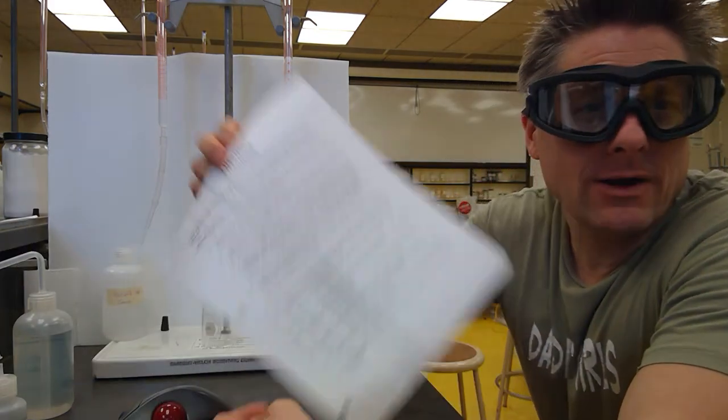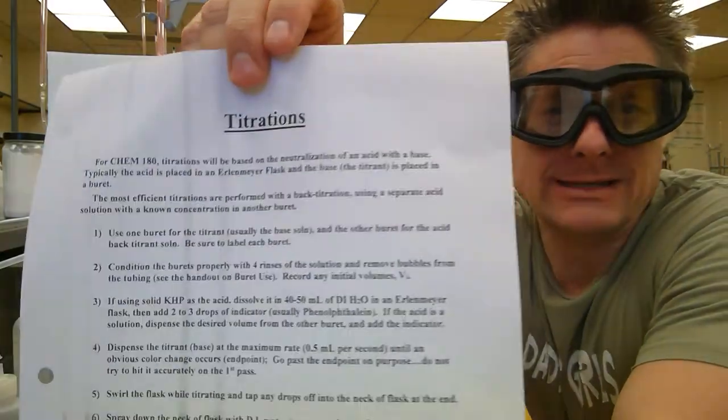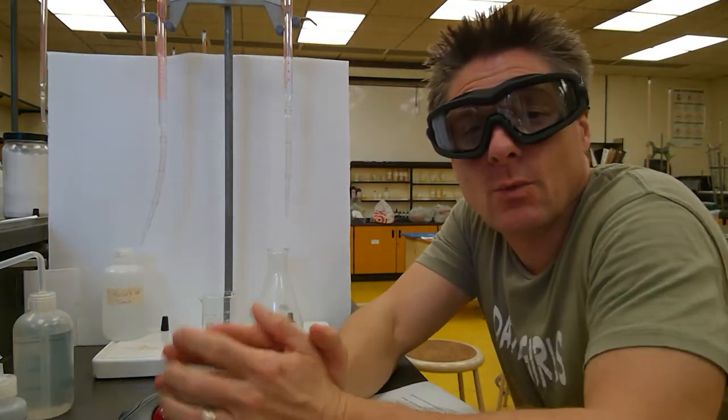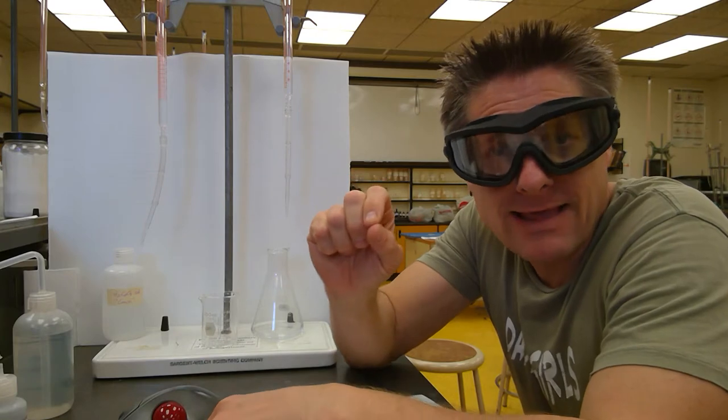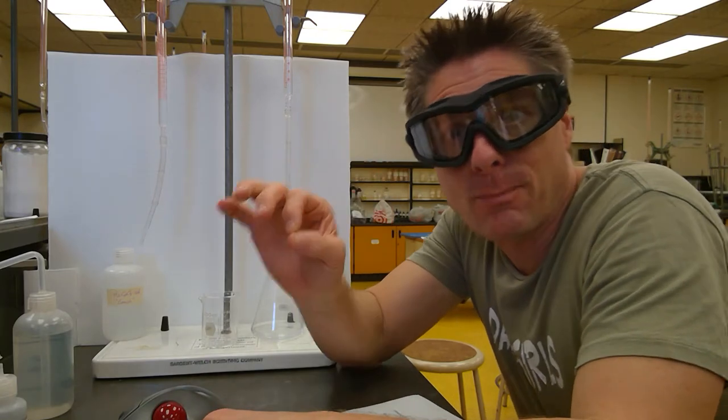Well, hey there, guys. We are going to do a quick little video on titration techniques, kind of the pitfalls that students run into and what to watch out for. Especially in general chemistry here, we like to do back titrations, which I think allow you to go a bit faster and you don't have to be so paranoid about getting past that endpoint. We're going to go past that endpoint on purpose, right?